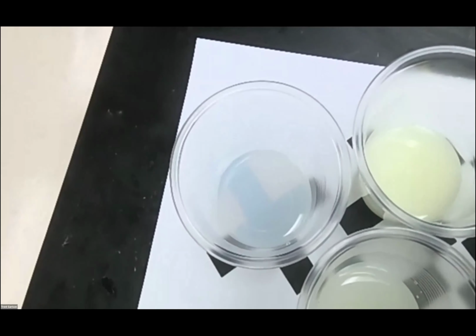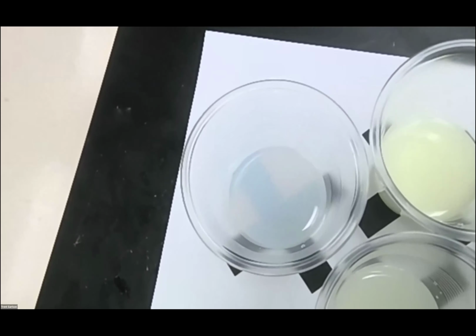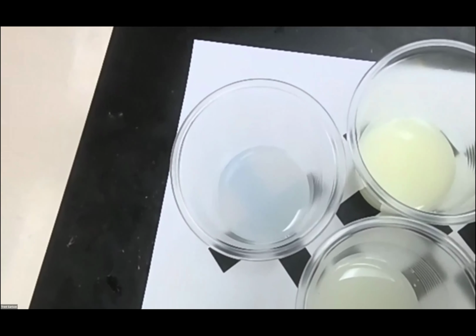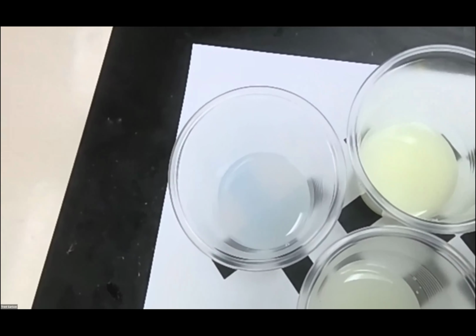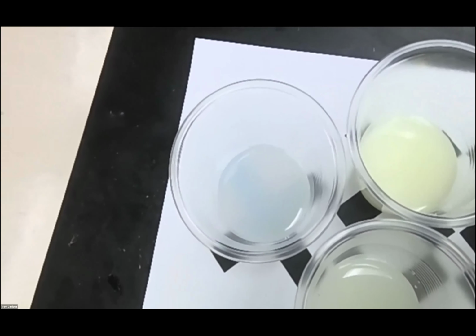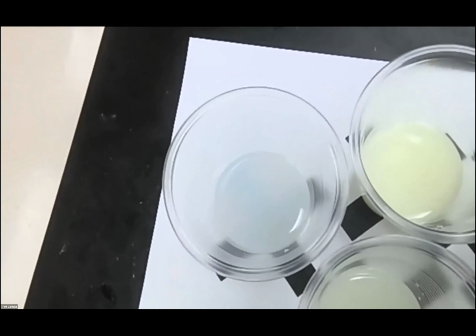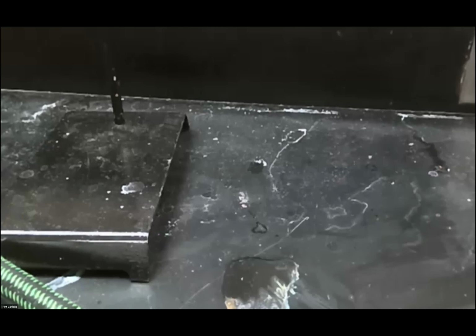I can still see the X. It is not fully obscured yet. And we are at 2:10. So I could still see the X. At this point, I'm going to call it. Now I can probably no longer see the outline of the X. So that is 2:27. All right, so let me share my screen.